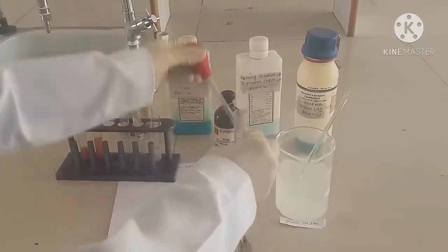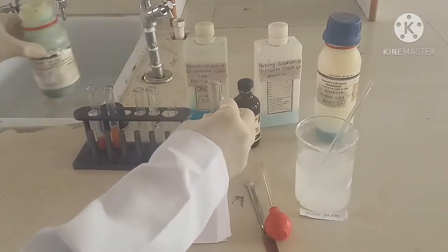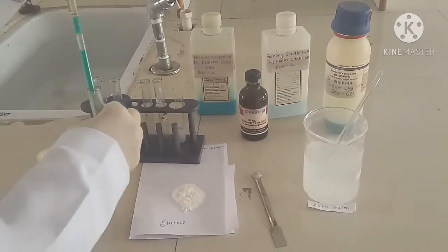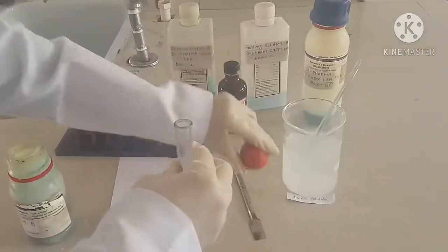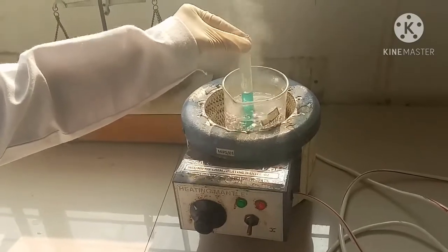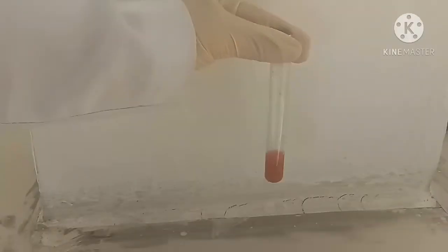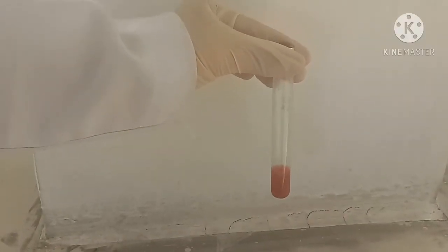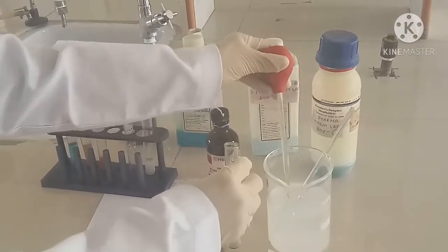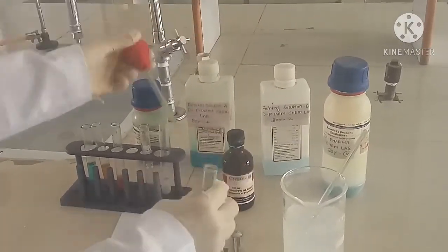Then perform the Barfoed test of carbohydrate. Take 1 ml of sample in a test tube, then add the Barfoed reagent in the test tube. Keep in a boiling bath and look for the development of a brick red precipitate.